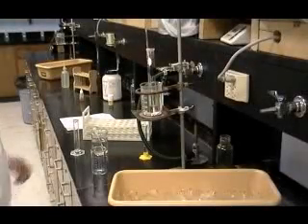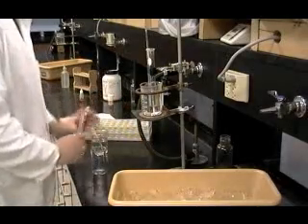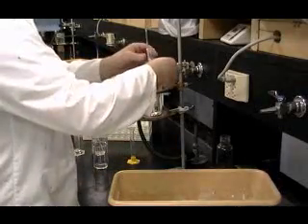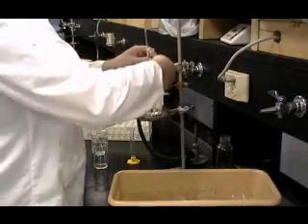To begin step 4, prepare a 150 milliliter beaker by pouring 5 milliliters of room temperature deionized water into the bottom.